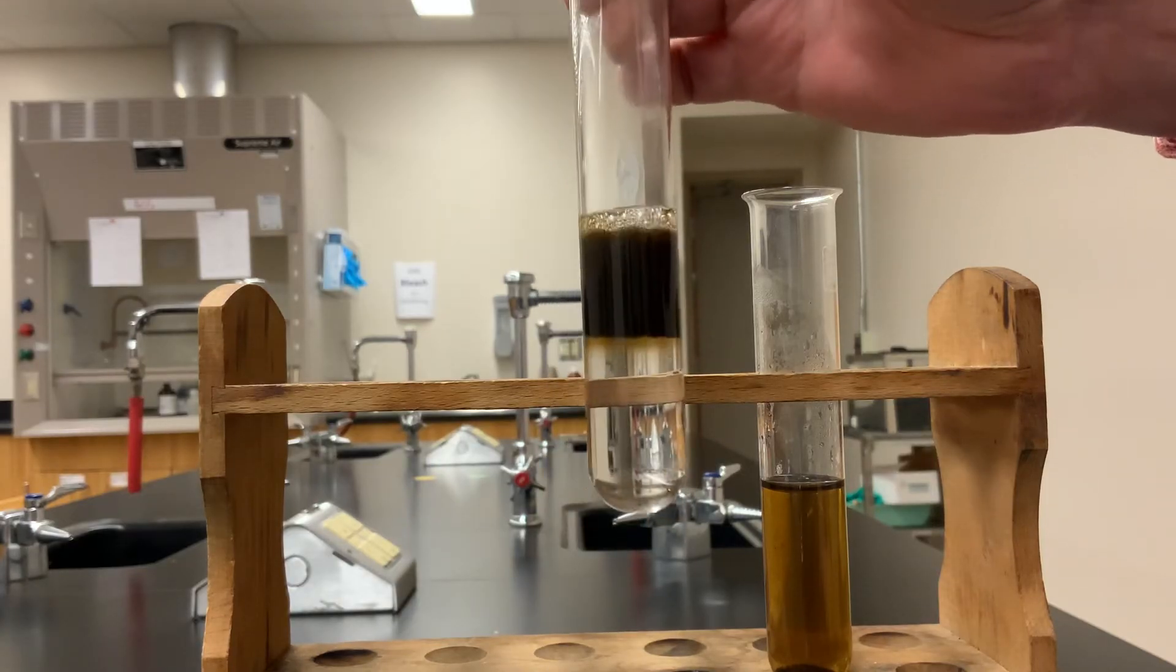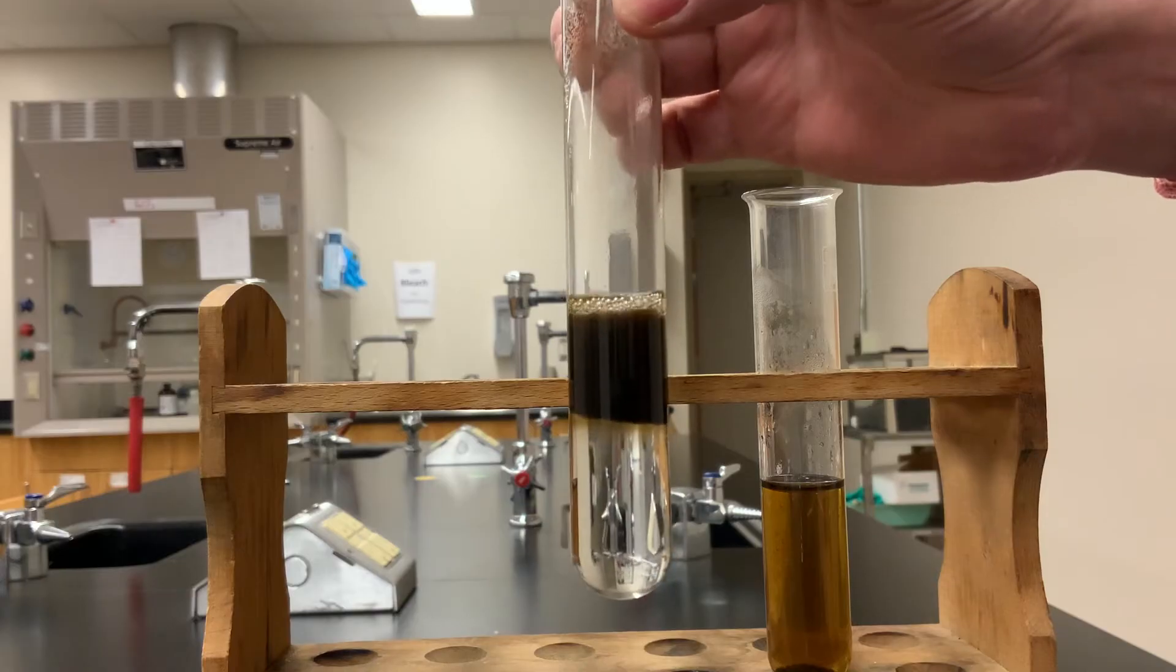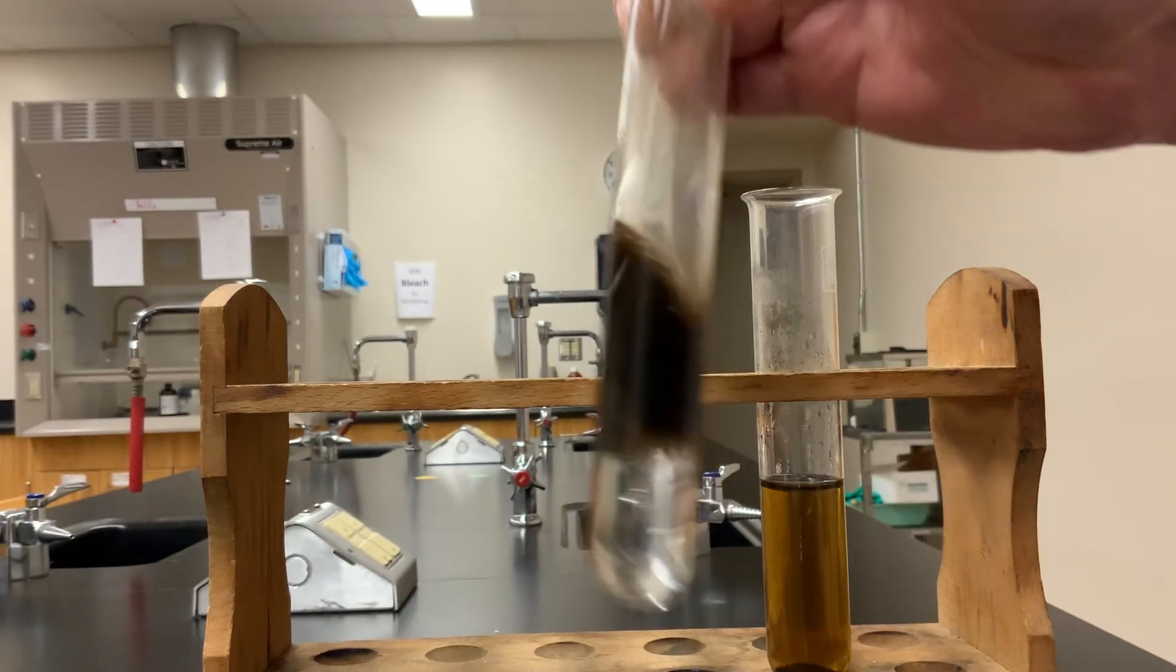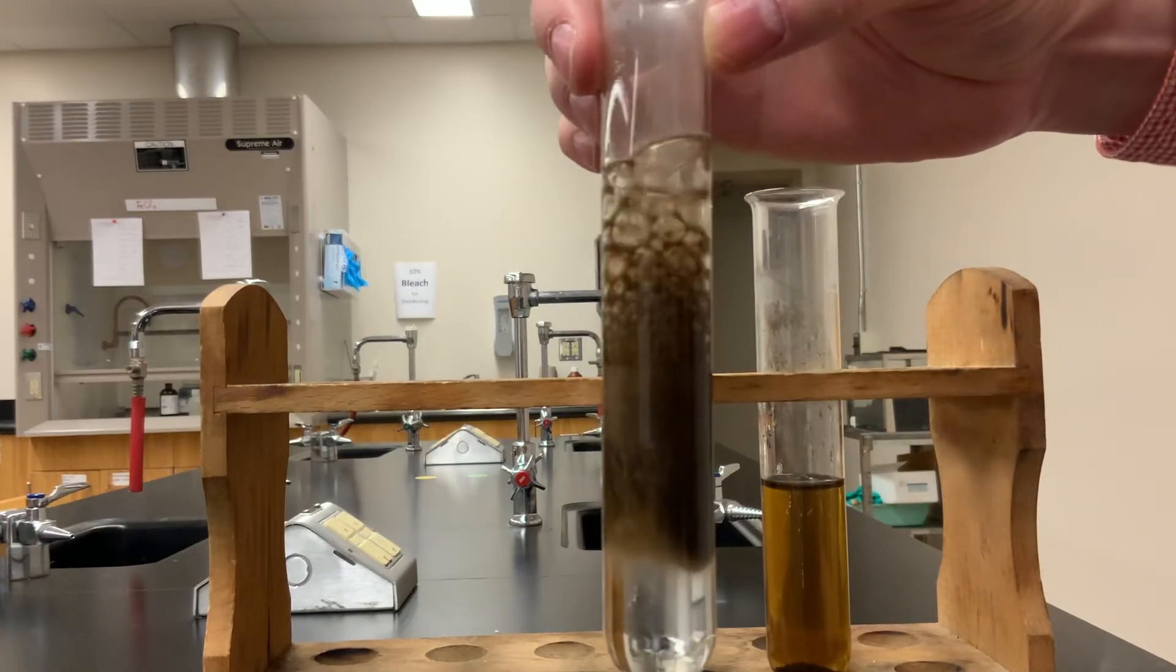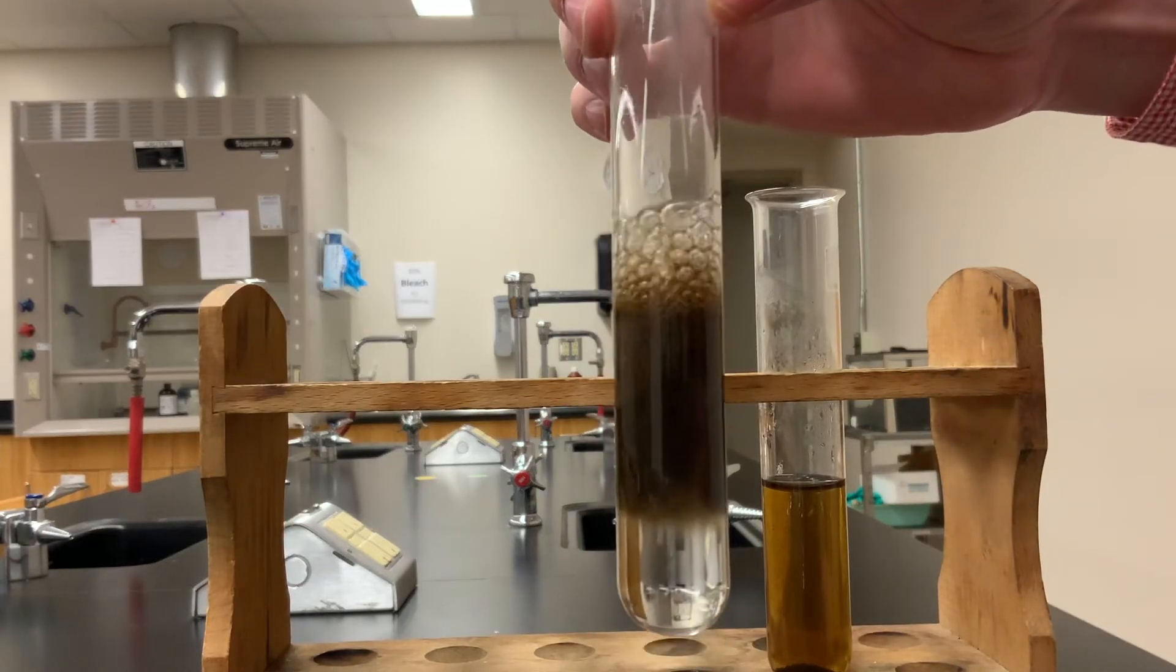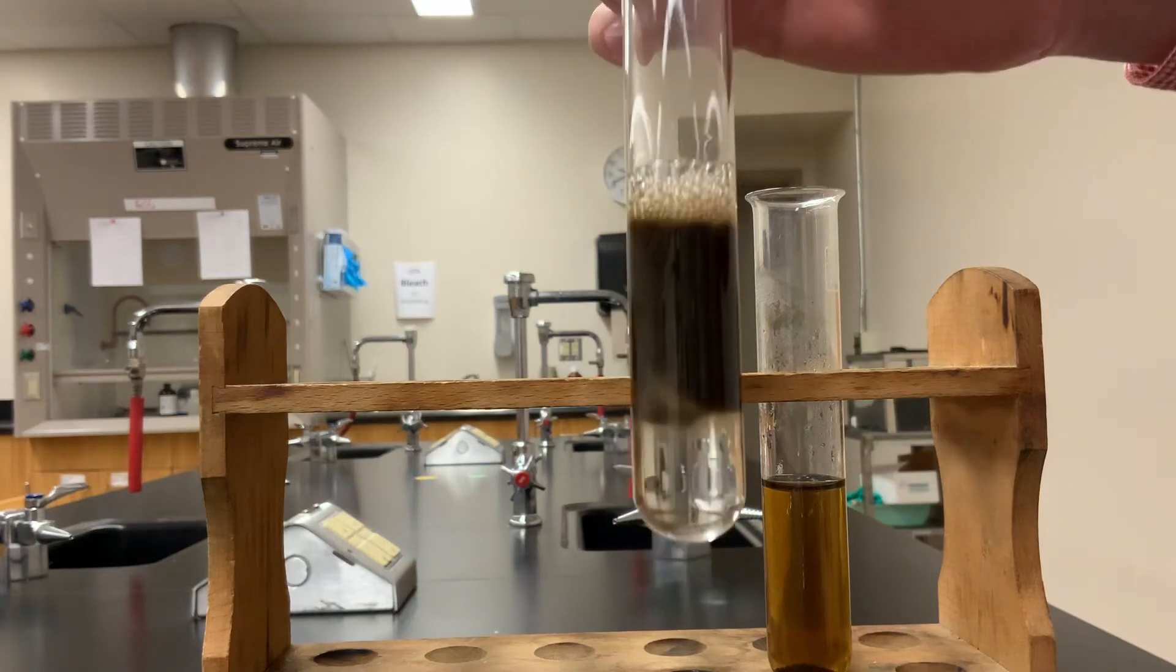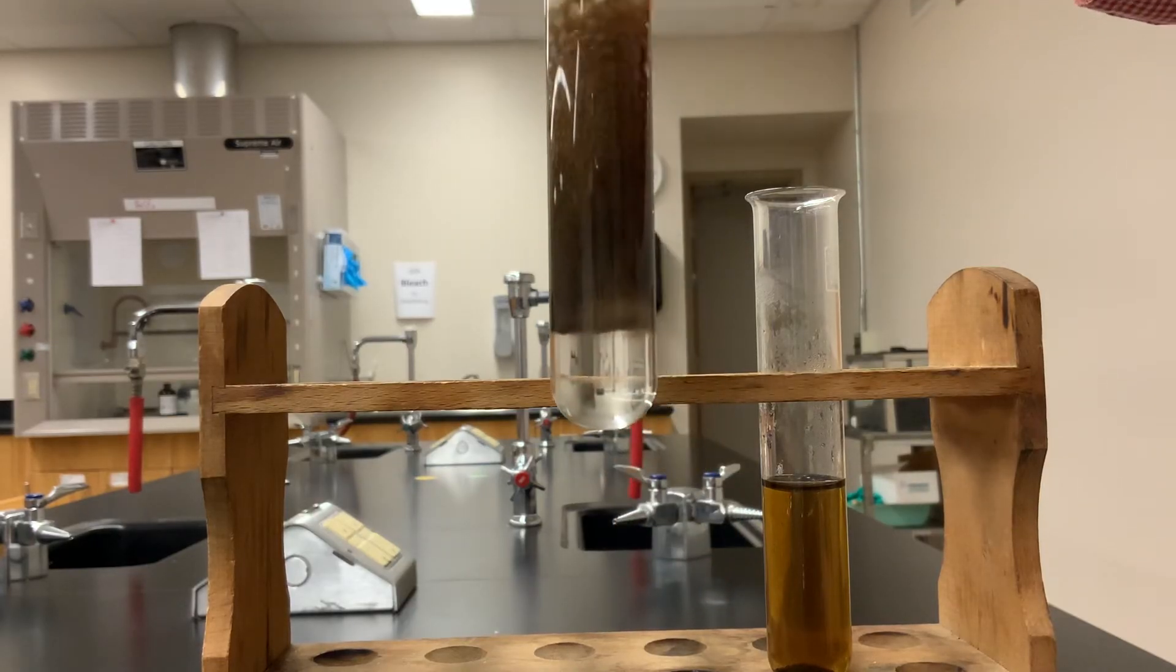Give it a swirl, mix it with the hydrogen peroxide below, and it definitely reacts even more. So there's some density stuff going on there as well.